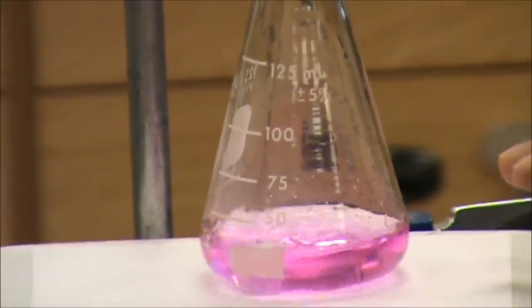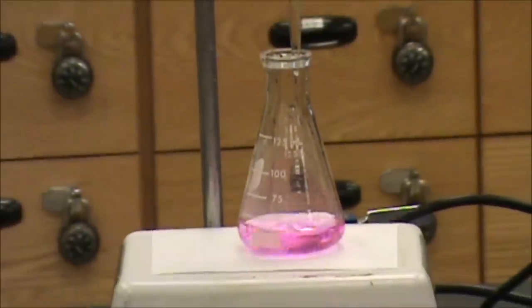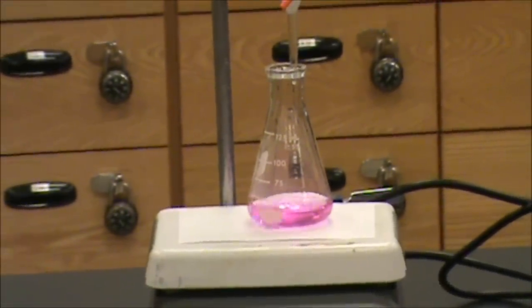As you can see, there's a very obvious color change. And we pinpointed the volume down to an exact drop of base being added.